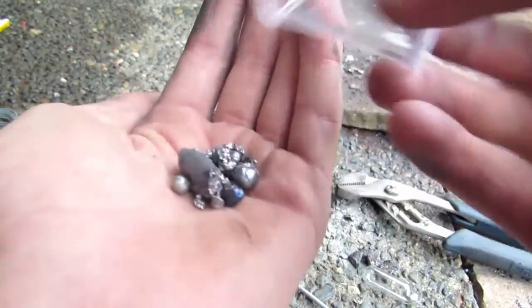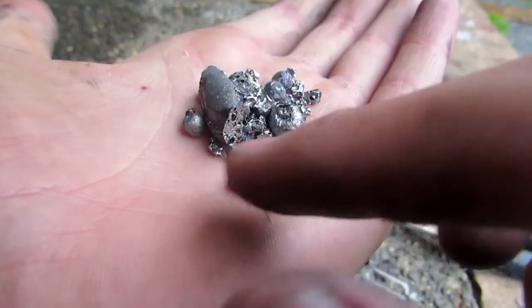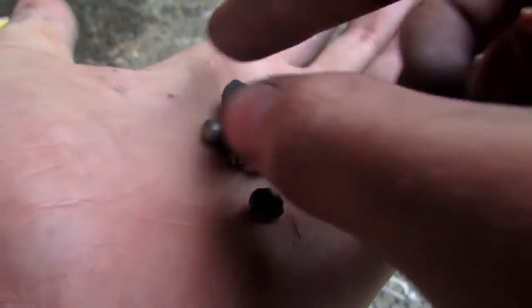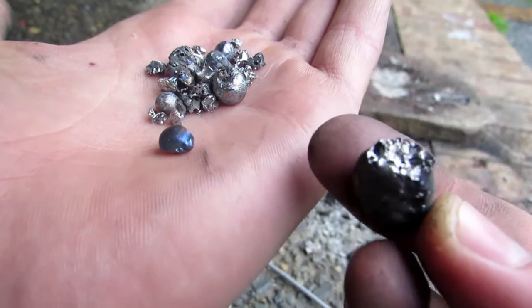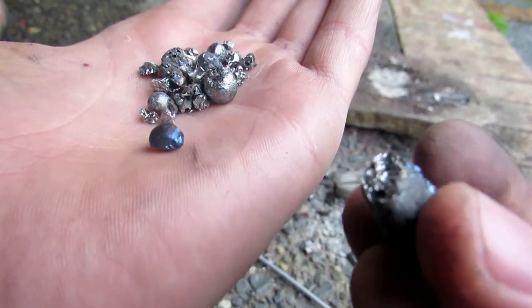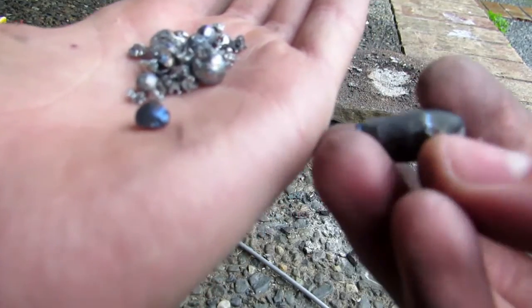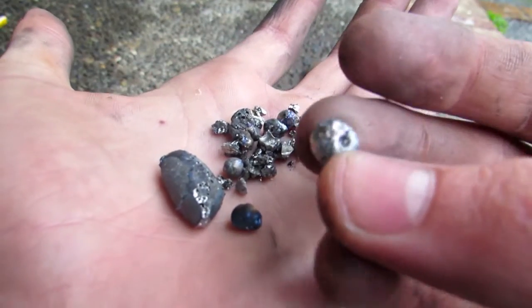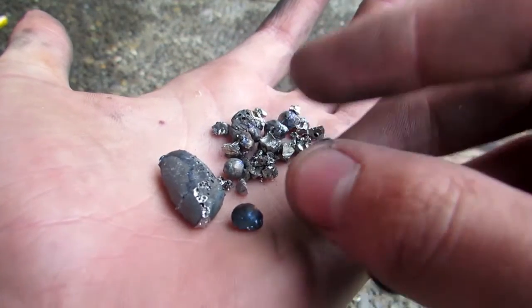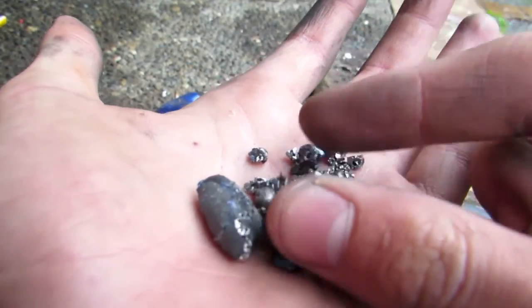With this reaction, most of it didn't vaporize and we got some beautiful pieces. You can see some of them are beautifully oxidized, making beautiful blue colors. We even got this beautiful big bead of manganese metal — a little piece chipped off and you can see the beautiful shiny surface on the inside. Some of the beads that didn't get oxidized are beautiful, shiny, and round, and there's a beautiful air bubble cavity.